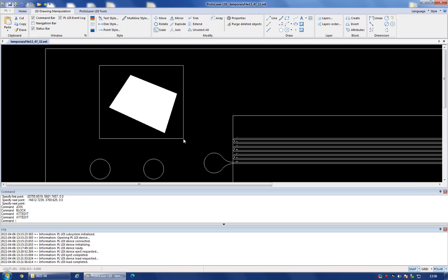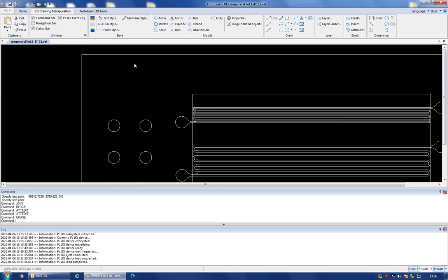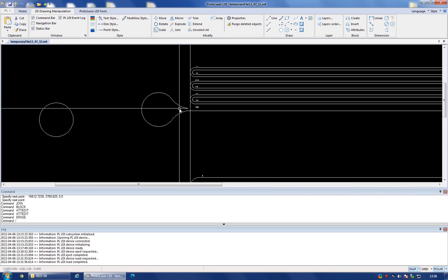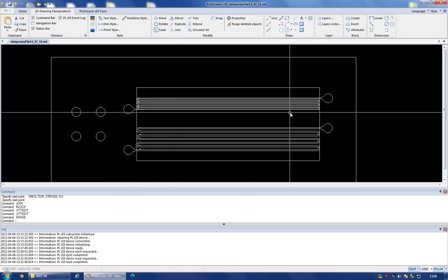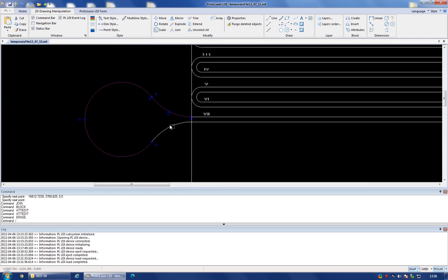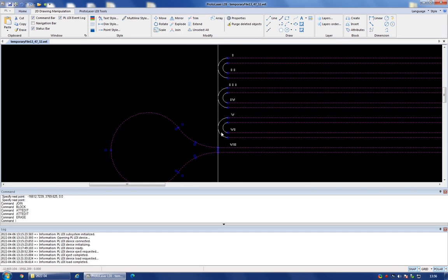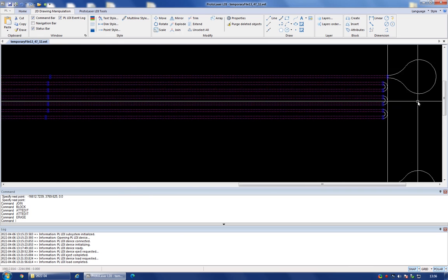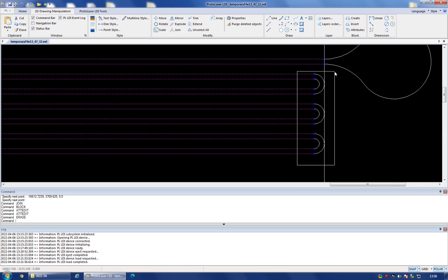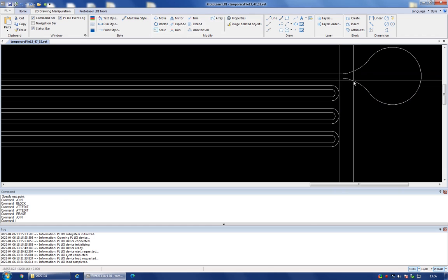And I can show you how I would go about setting up my own structures. So I'm just going to select this and press the delete key and move on with my own structures. For my own structures, you see that I've got these two long winding channels with these inlets here. So all I need to do now is to select all of these and make sure that they're all joined together. So I'm going to select all these shapes and lines, like so. Select them all like that. And now I'm going to hit the join command, and this should now belong to a single shape.